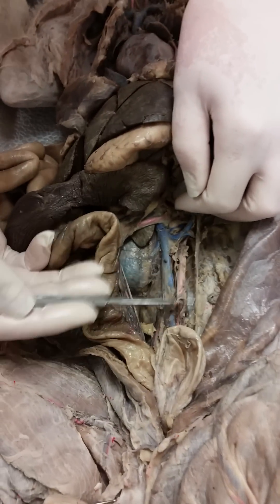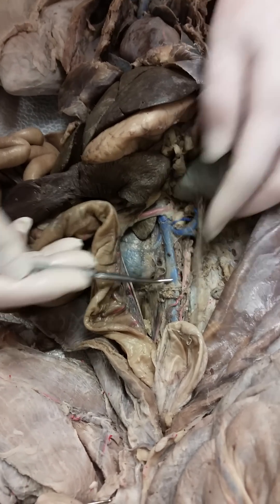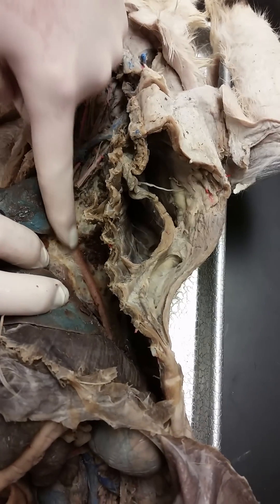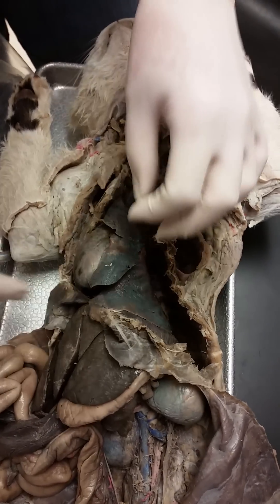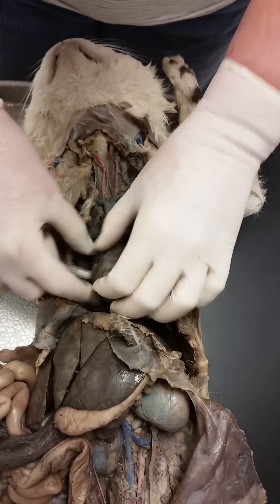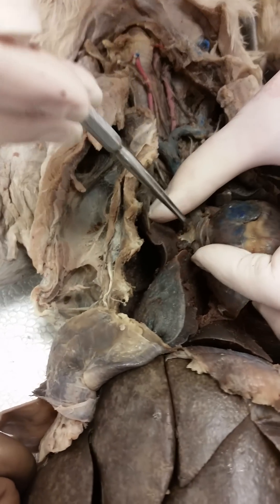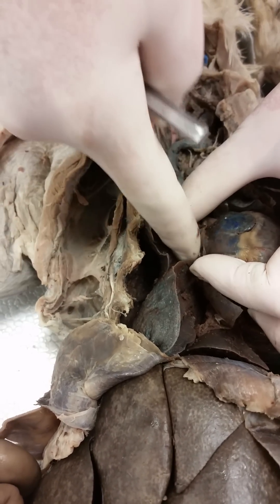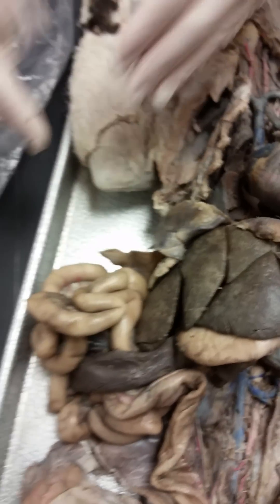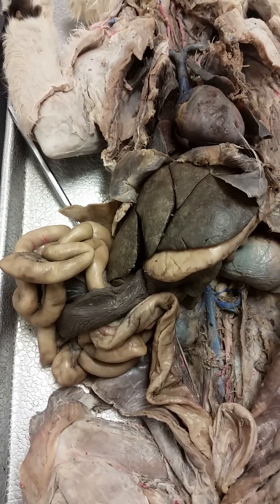Here is your abdominal aorta. And then this is your inferior vena cava. Your thoracic aorta is right here — it comes off the heart. And this is your lungs. When you cut off a piece of lung, you'll see a hole. That hole is a bronchus. Inside the intestine, you have villi. And then you have rugae also inside the stomach.